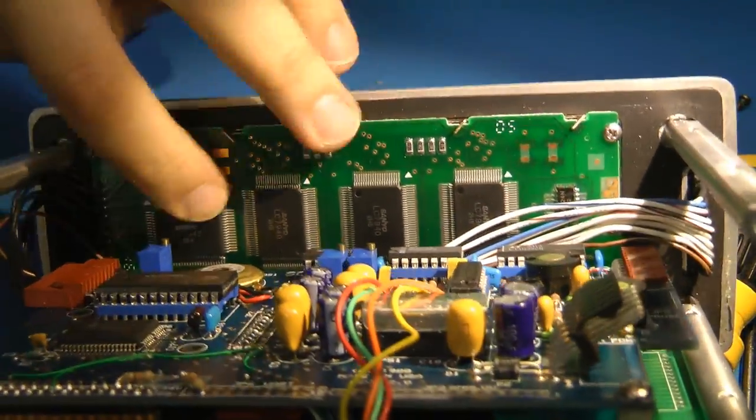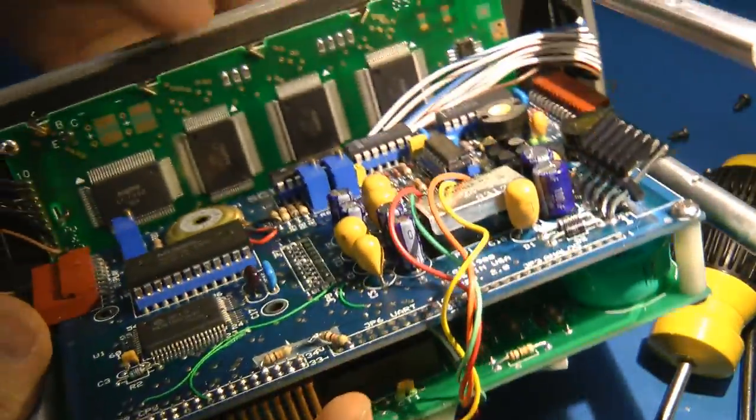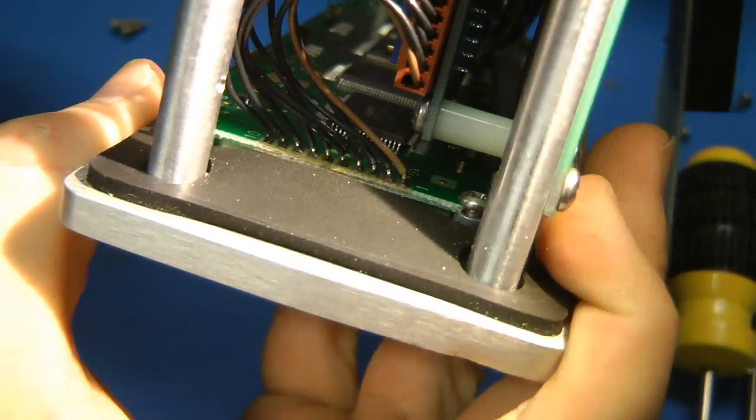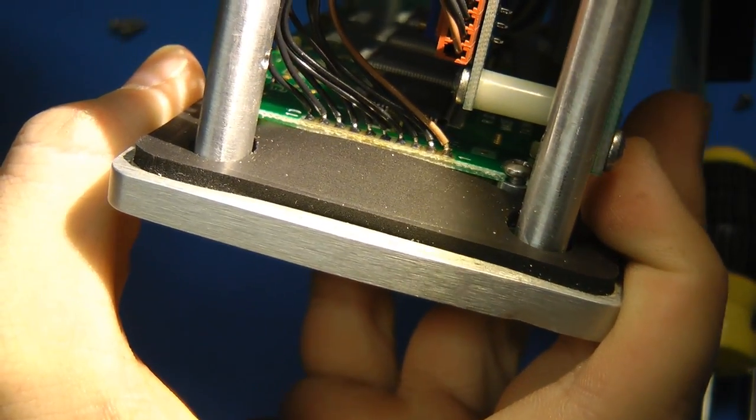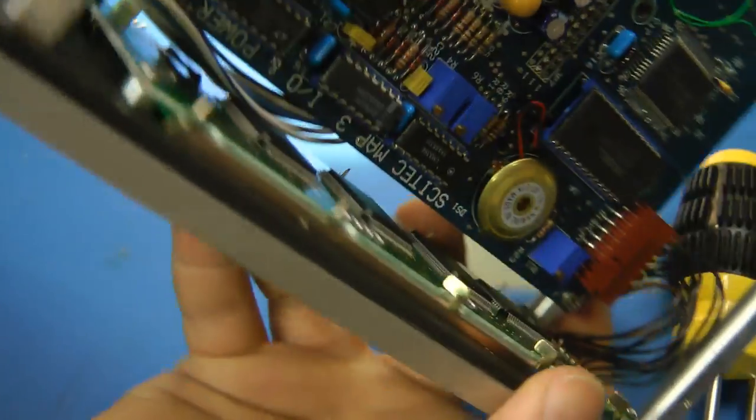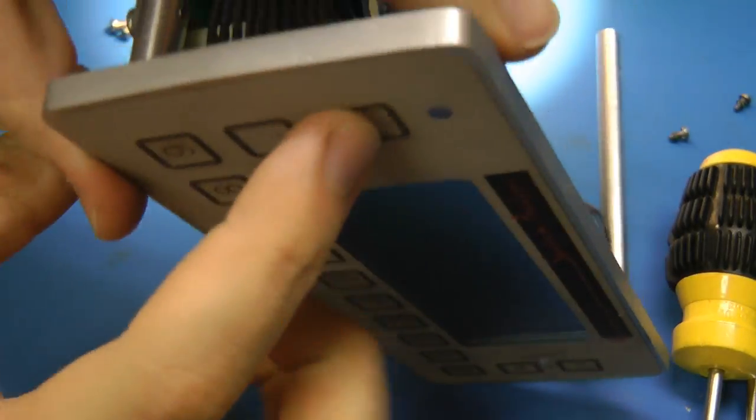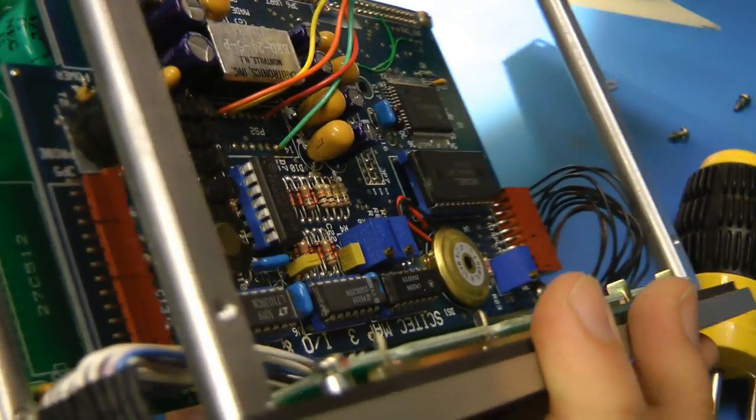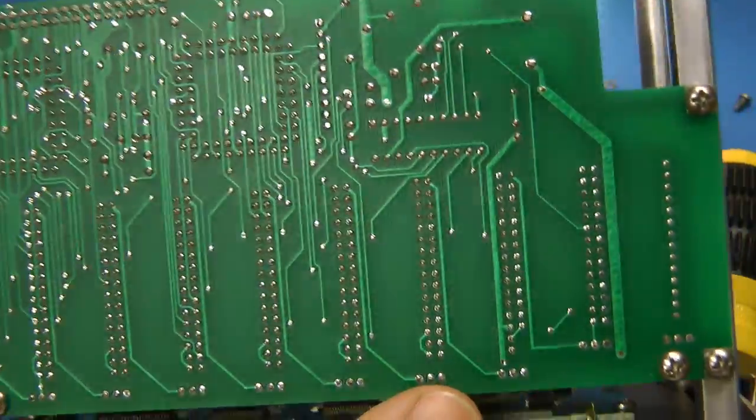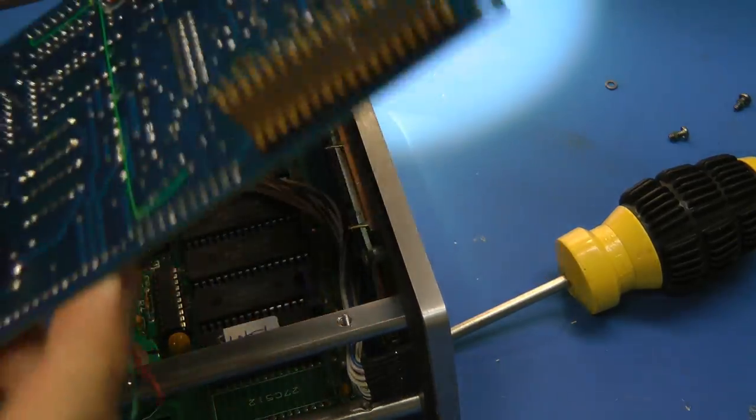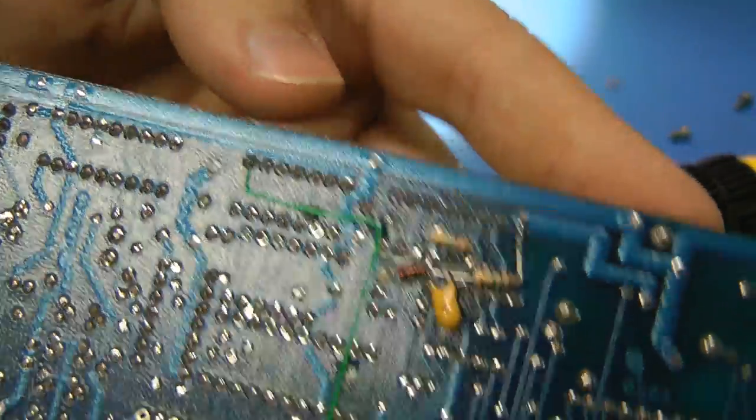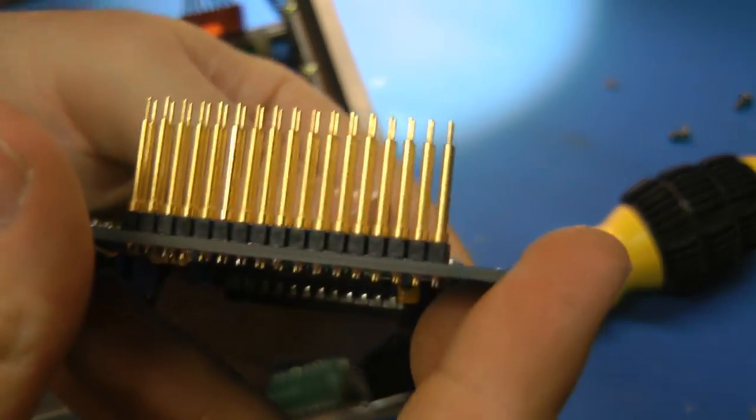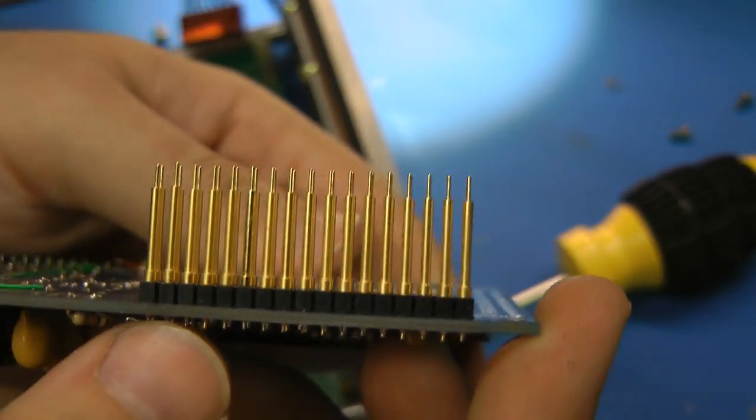On the front there's a pretty bog standard LCD controller. LCD with Sanyo control chips for the Matrix LCD. All hand, yeah. A lot of labor went into this. These are hand wired, hand soldered into there. What else? This is going to be for another hand soldered connections for the membrane key panel. And let's get this off and take a look at this other board that actually has the CPU and probably a bunch of memory on it. A few minor bodges in the back of this. But nothing too bad. Really nice gold plated connectors there. That would have been expensive.